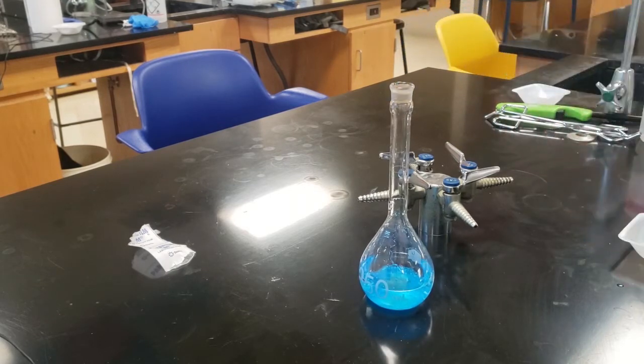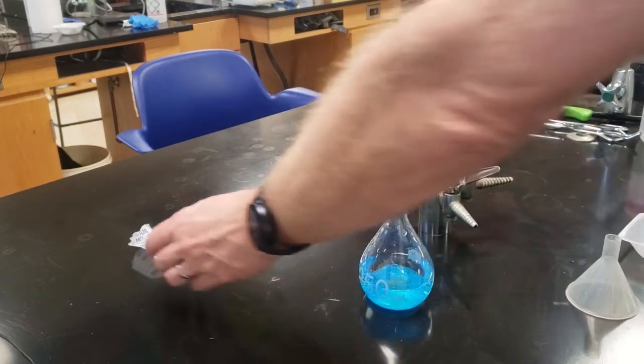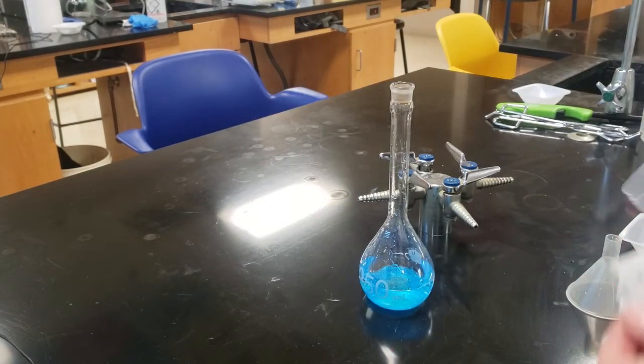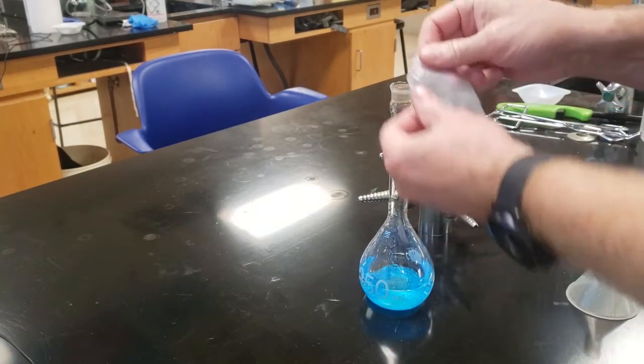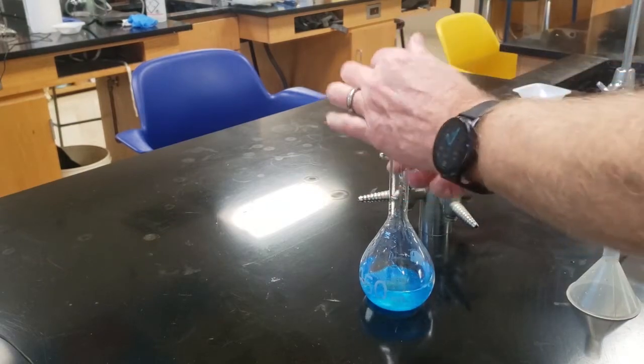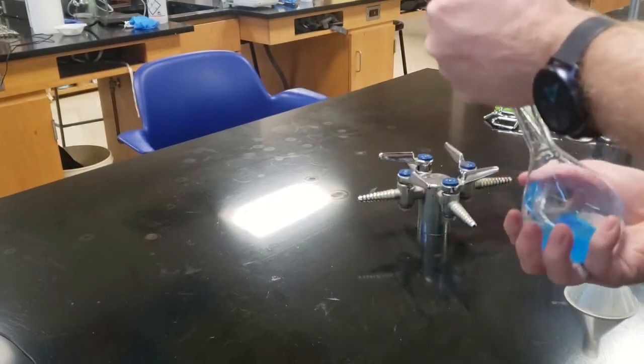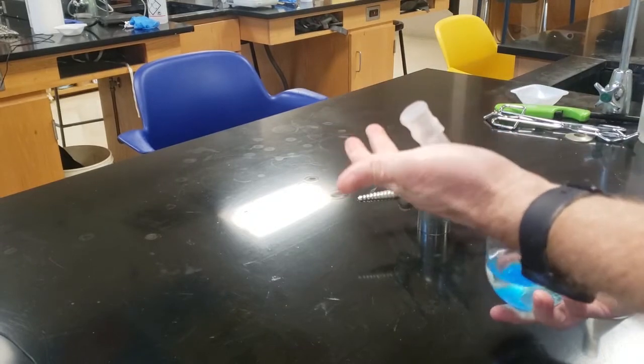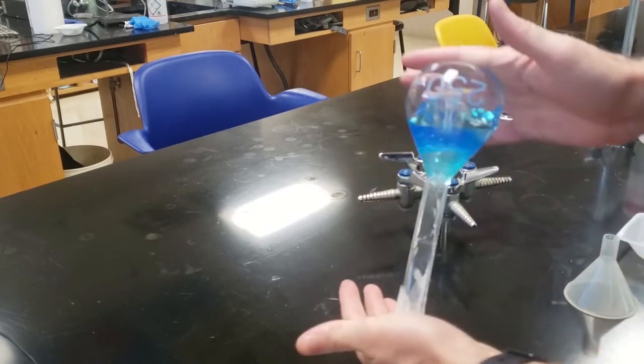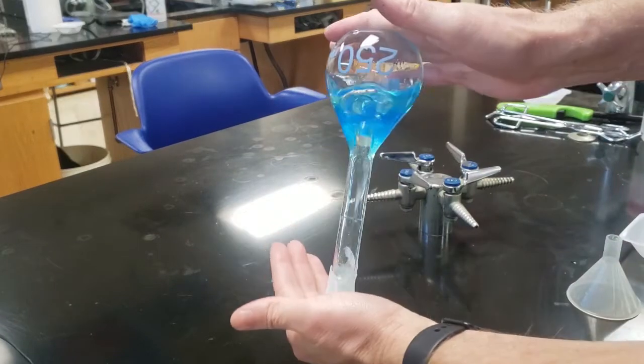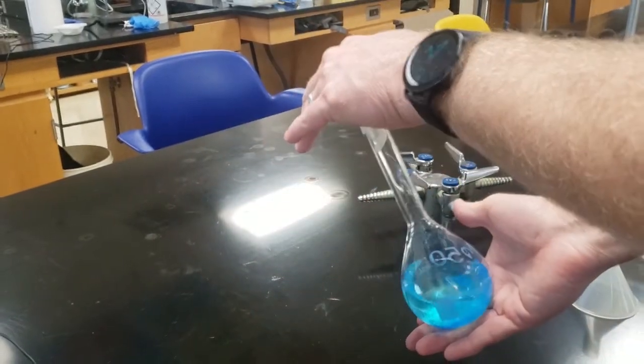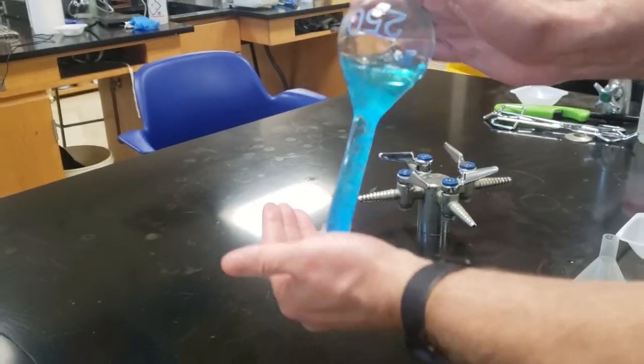Here's where we get our little piece of parafilm. We take the plastic piece, take the paper off of it, and it's somewhere between wax paper and parafilm. We stick a little on top, kind of bend it down, rope it around a little bit, and then I still don't trust it. So I put my hand actually on the edge and go back and forth with it until it's dissolved. It won't dissolve immediately. You have to do this for a couple minutes.